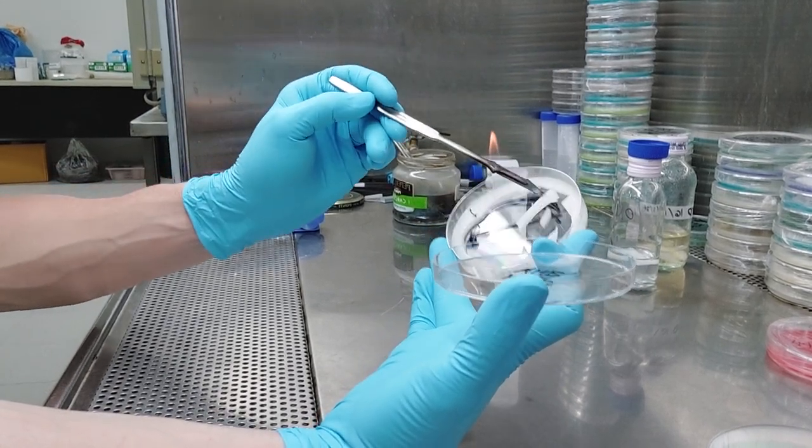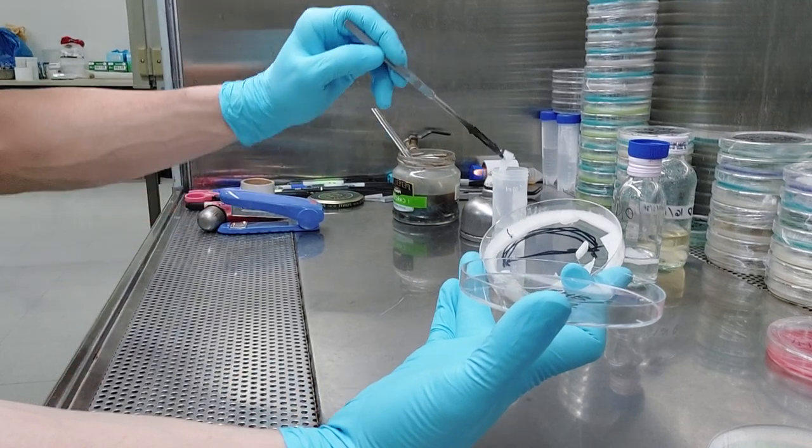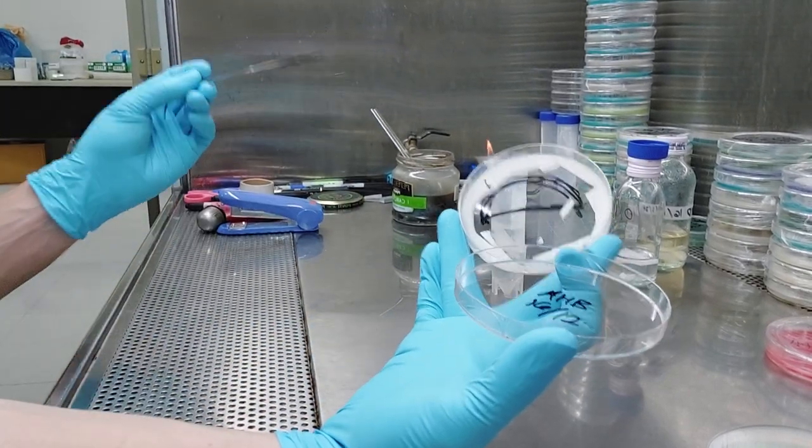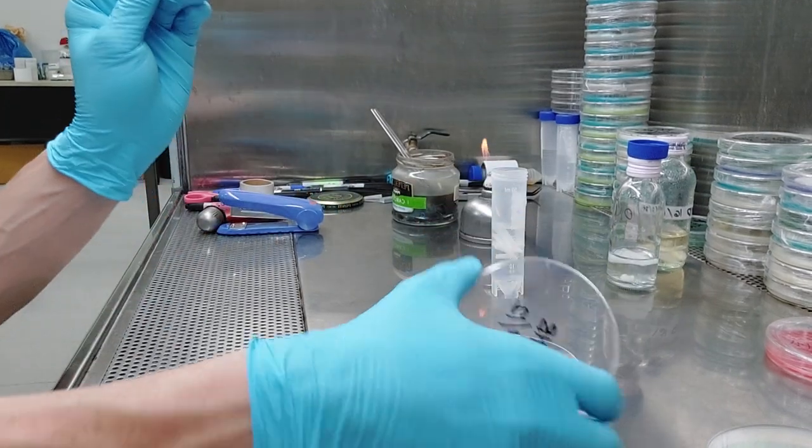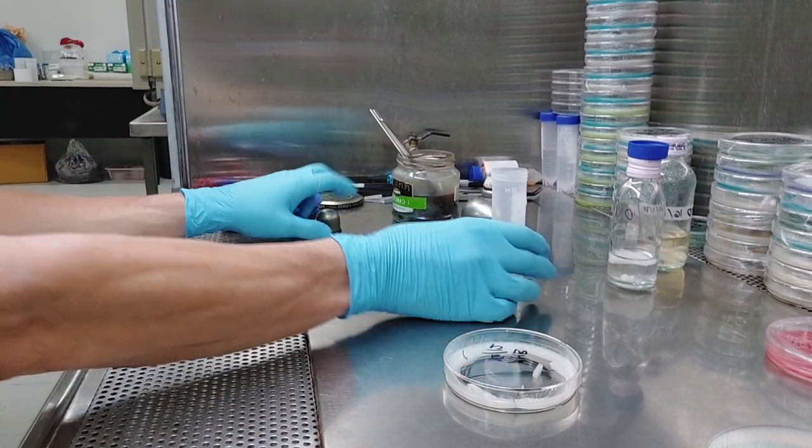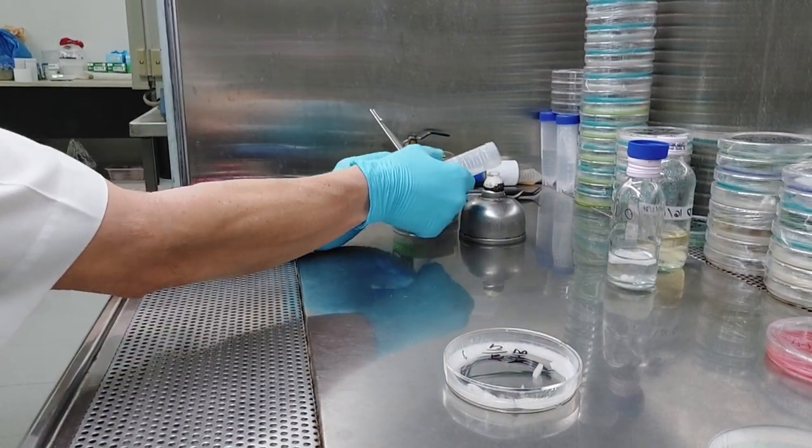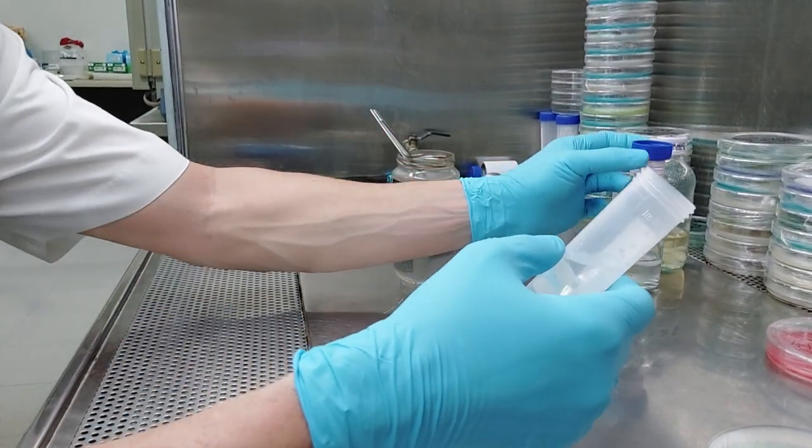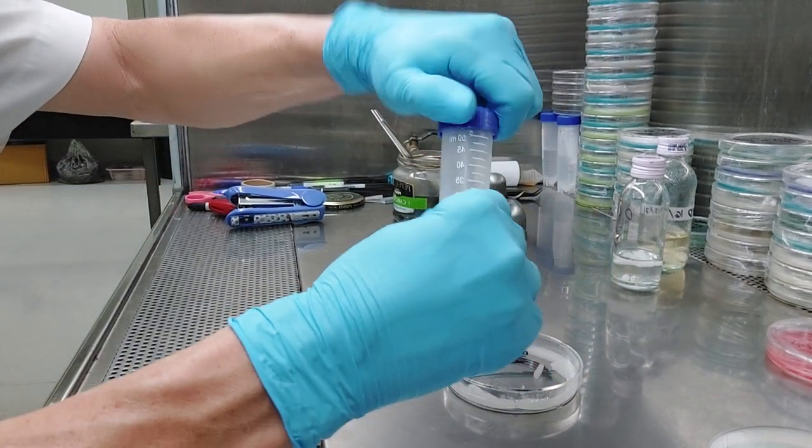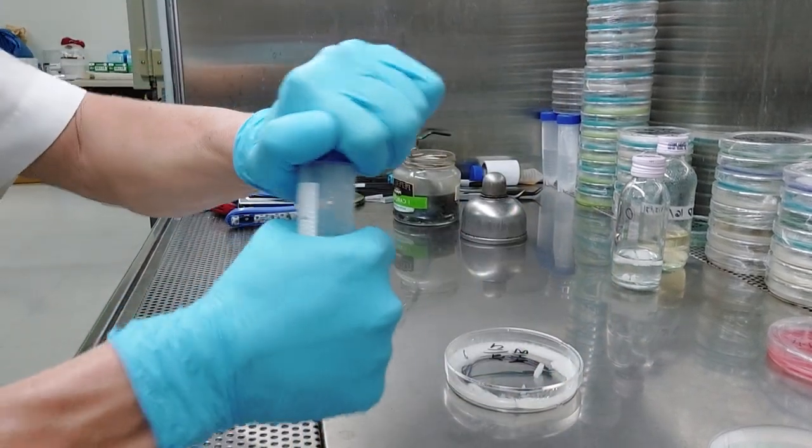The edges are dirty, right? So I'm going to do this even more. I'm going to take that out. So that's garbage. So I'm going to, Jesus, flame this for a second. It's getting warm in here. Covered this up and mated with the inside of the cap. And that's it. Bam. I'm going to save this plate, right?